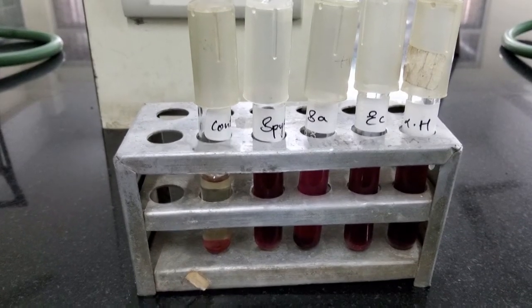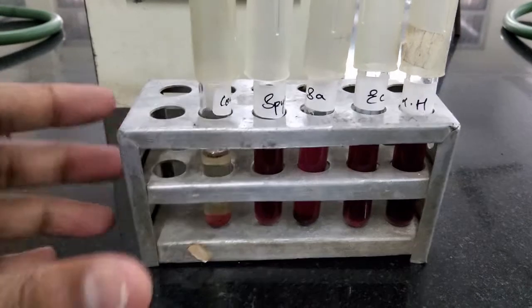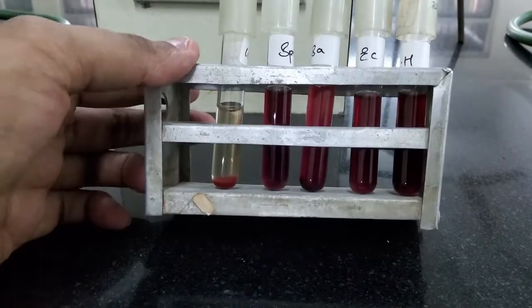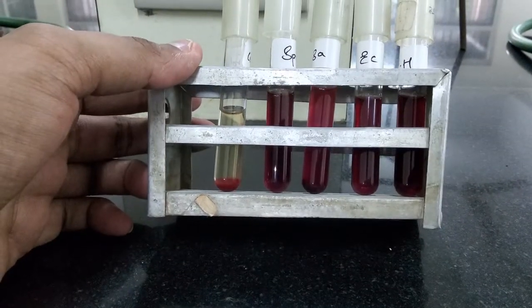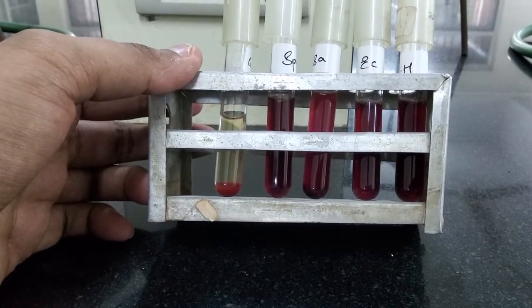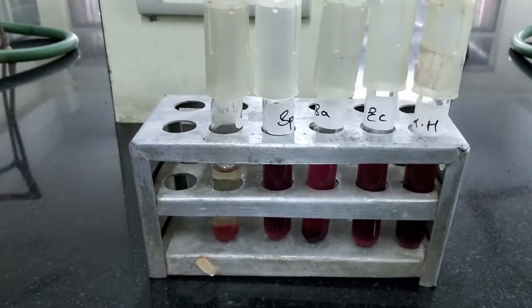This is how all the tubes look after the experiment. You can clearly see that the control tube is clear while all the remaining tubes are completely red in color.